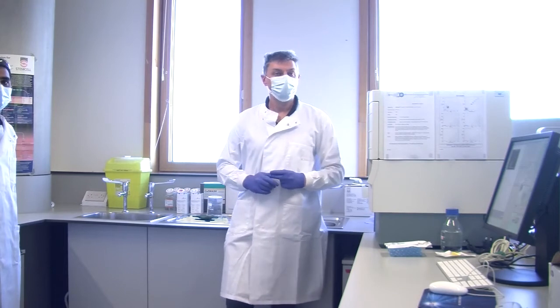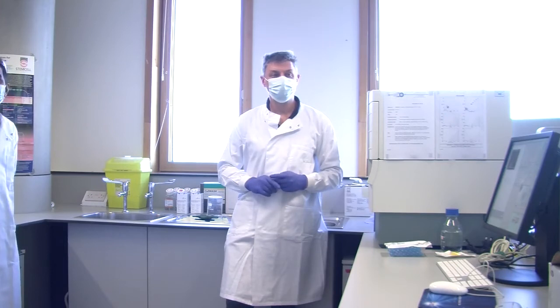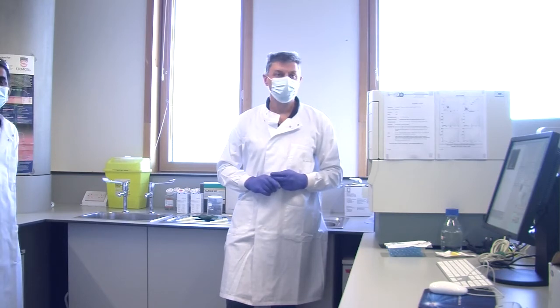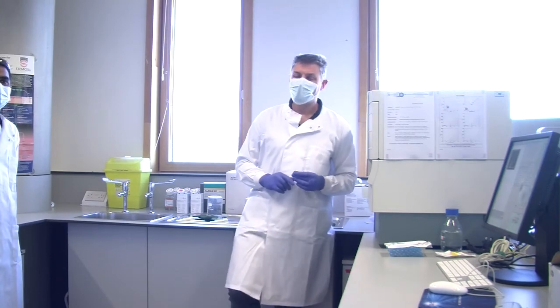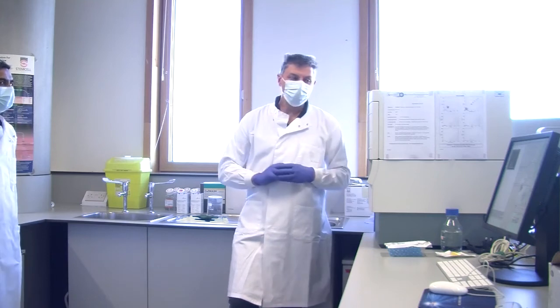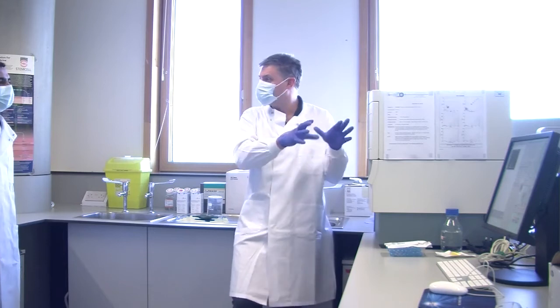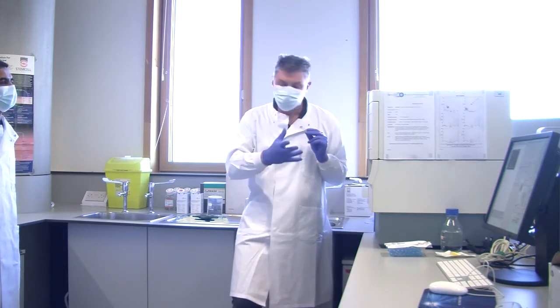So when you are collecting your data, this type of graph will be generated. For the report that you need to produce, you need to make sure that you understand these parameters and what they mean in order to do your data presentation and data discussion. So it's quite relevant that you get these things right. Yeah, absolutely. The interpretation of these is critical. And in the antibody incubation stage, we'll look more at what the data looks like on the plot and what it means.